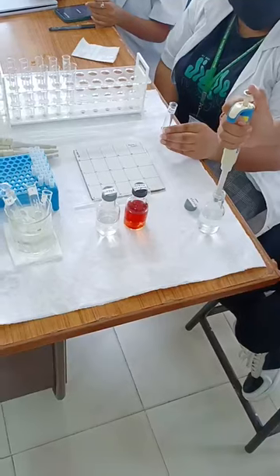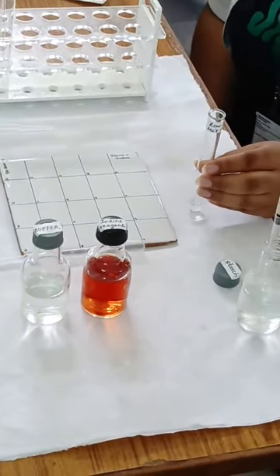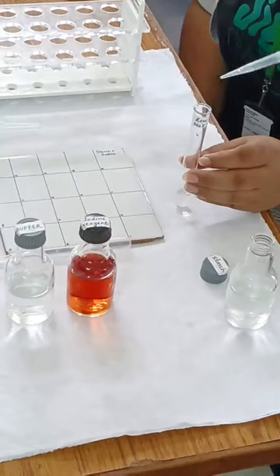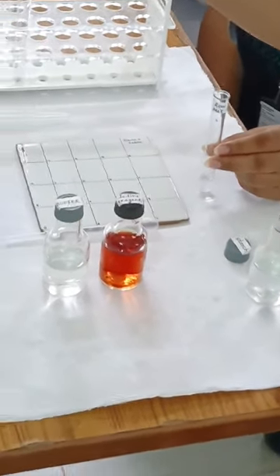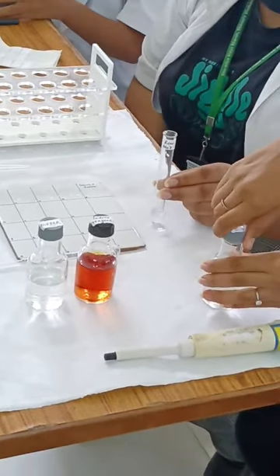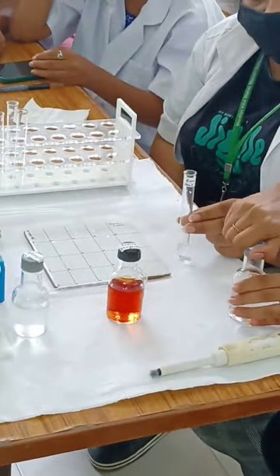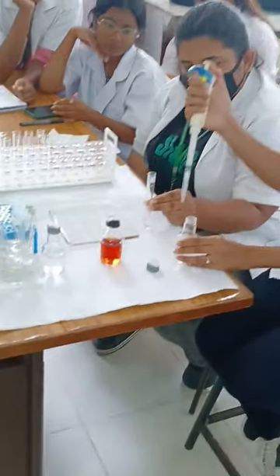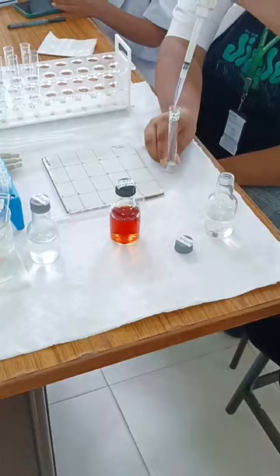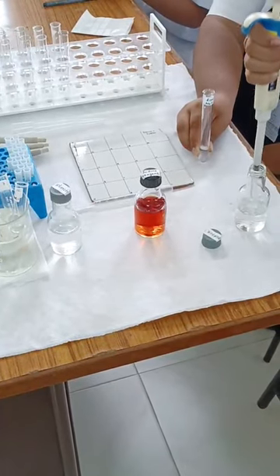Student Prerna is taking 1 ml of starch and transferring it into the reaction mixture tube, then adding 1 more ml into the same test tube so that the total volume of 0.5% starch is 2 ml. Next, after adding the starch, we are going to add 2 ml of phosphate buffer. It is 20 millimolar phosphate buffer also containing 0.9% saline, at pH 7, being used for this experiment.